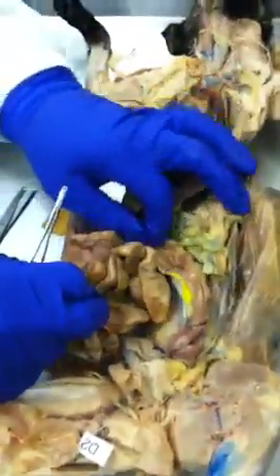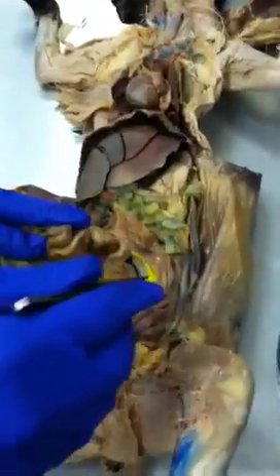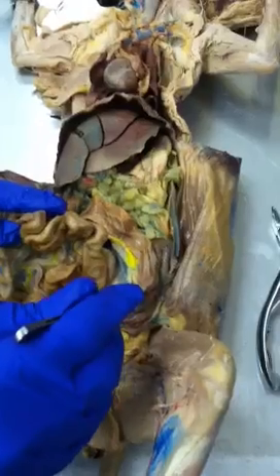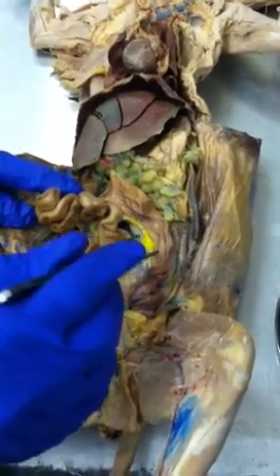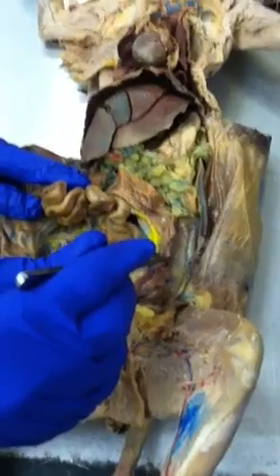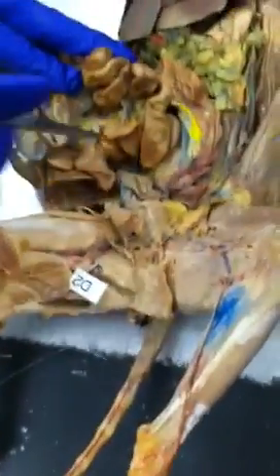And if I put one somewhere in the middle, you know that it will be part of the transverse colon that's going across. All right? And then the descending colon, I'll put it very close to the rectum, like right here. So that's where you can tell them apart. You see what I'm saying? And then of course the rectum and anus down there.